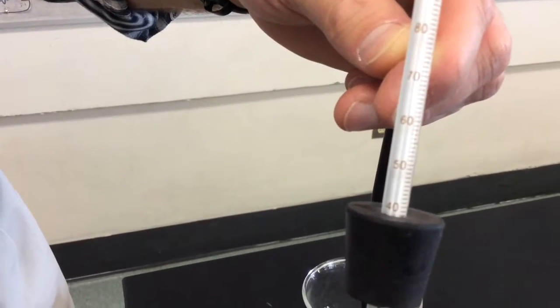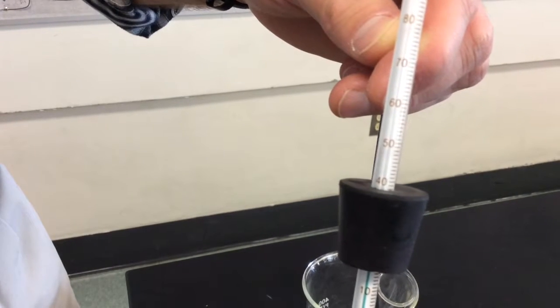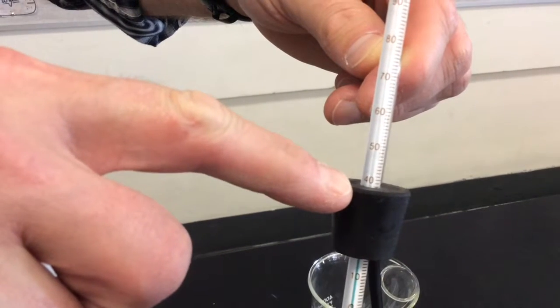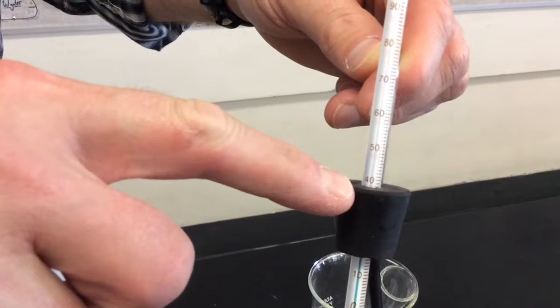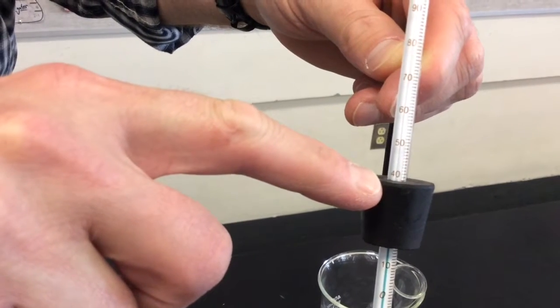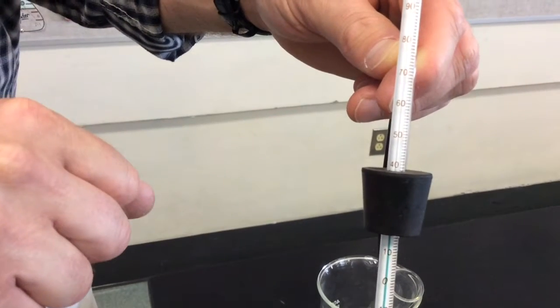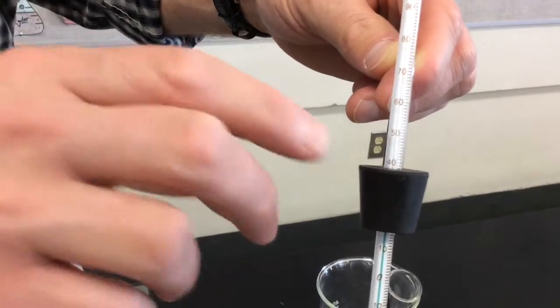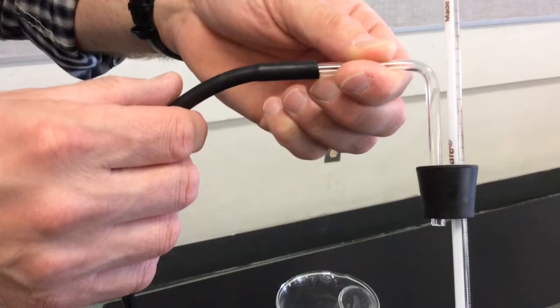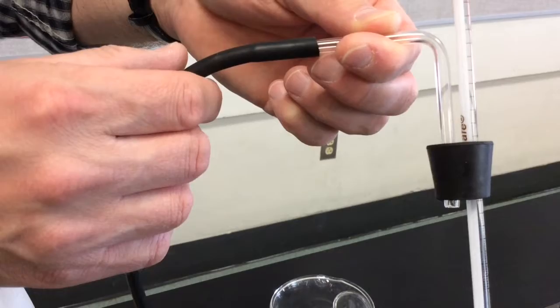You'll also have a number 4 2-hole stopper. In one of the holes in your stopper is going to be an analog thermometer. Most of the thermometers start above our stopper around 35 to 40 degrees. So you cannot take data until you see the green alcohol rise up inside the thermometer above the stopper. You're also going to have a glass bend attached to that, and a tubing in which you're going to collect the distillate, which is going to be the alcohol that you will distill from our original mixture.